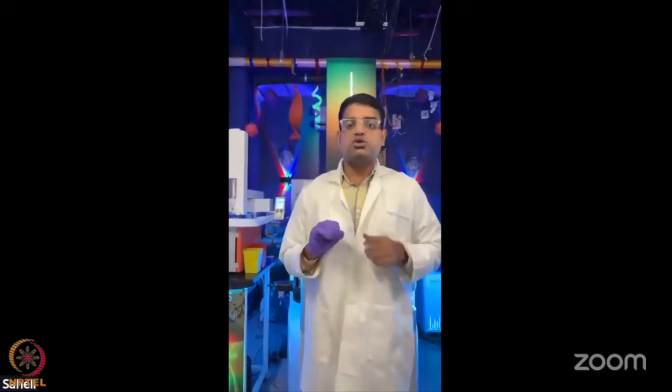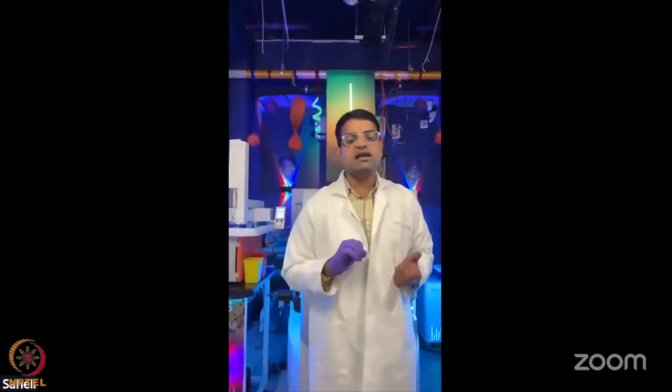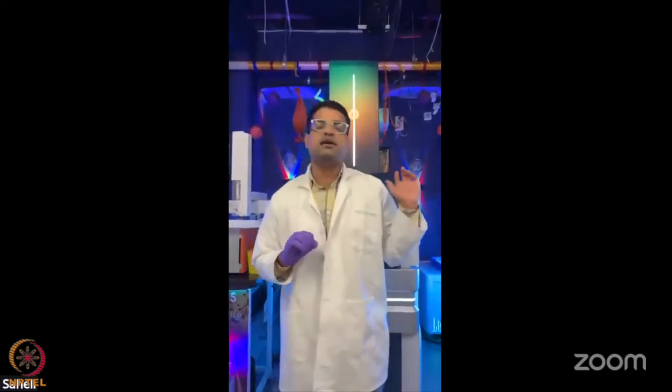The most important thing is that you can store the samples and analyze them after 6 months. As we have the property of ion mobility and the cross-sectional area, even if the sample is degrading or something happens, the areas will be the same. So reproducibility is very high in this kind of case.